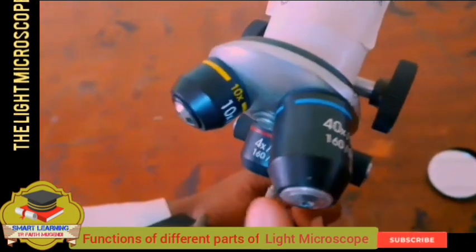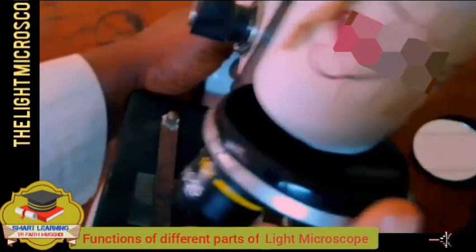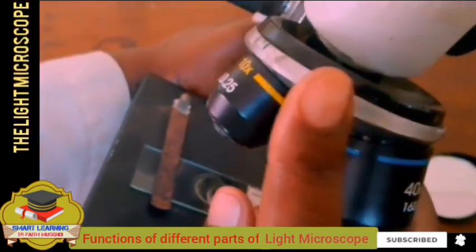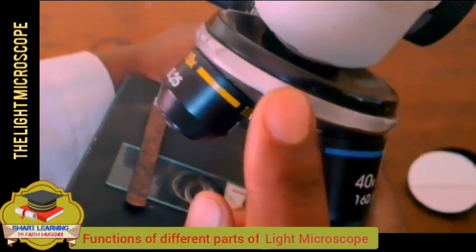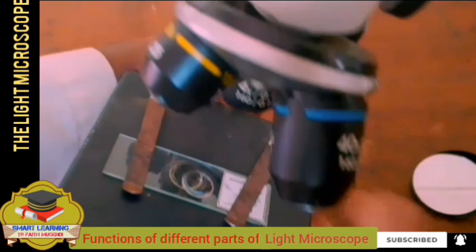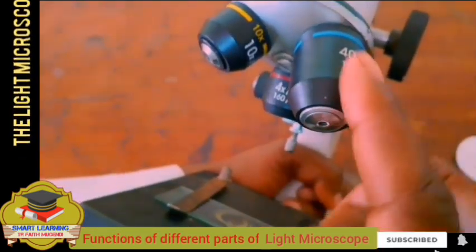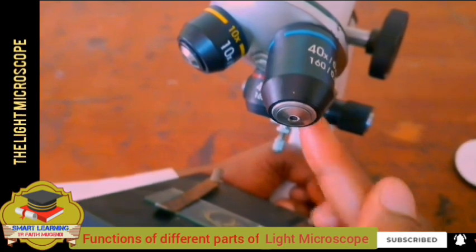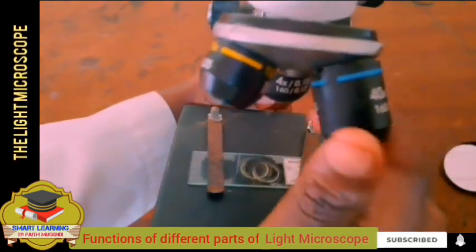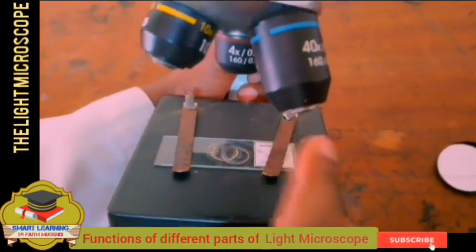Now, these objectives are attached to something called the nose piece. The work of the nose piece is to attach the objectives to the body, and it can rotate. Suppose you want to use the high power objective lens, you rotate it so that this one is directly opposite the stage, so that we can use the high objective lens to magnify.